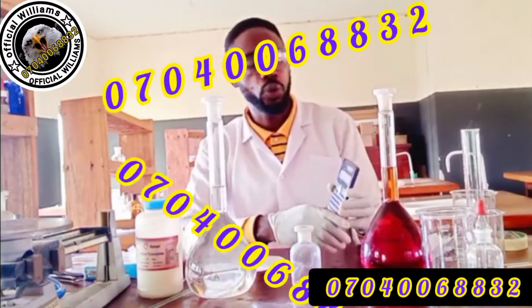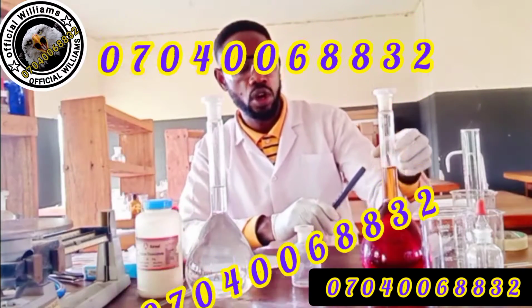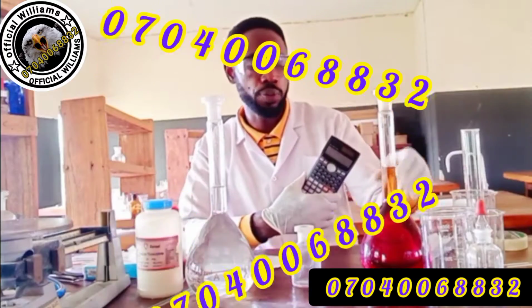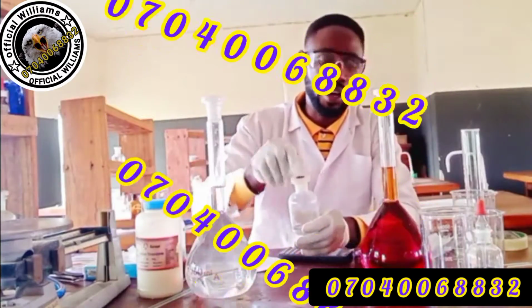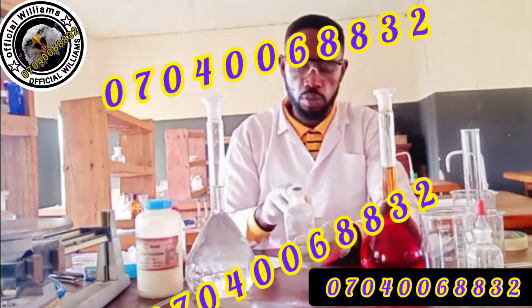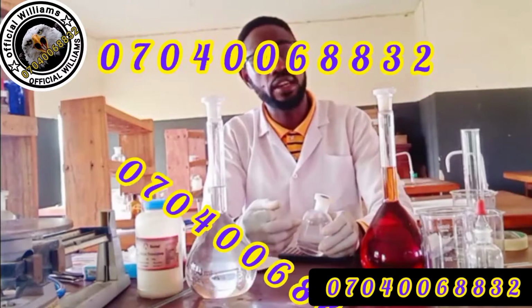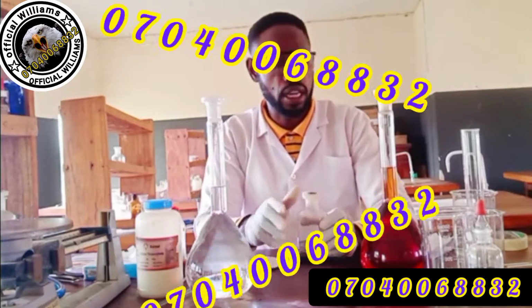That's 7.5, which means you prepare this. Each of these, you prepare it up to 8 times, because this is 7.5. So when you prepare 8 times, you now use this little 150 ml and add it more small for each student and label it AN, as they told you, where N is the registration number, the examination number of your student. This is the way to organize it.